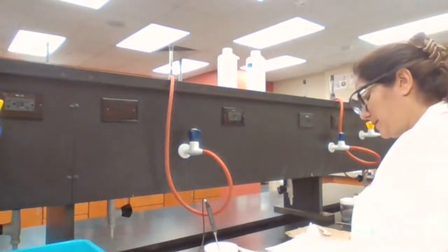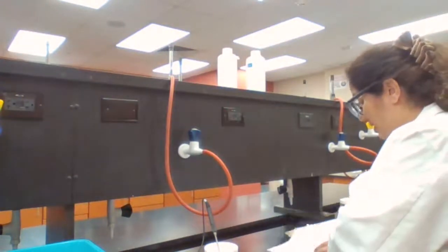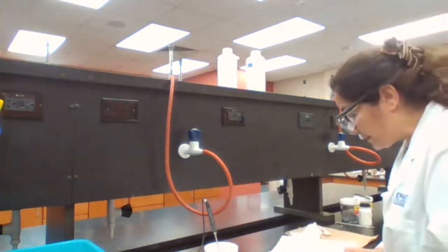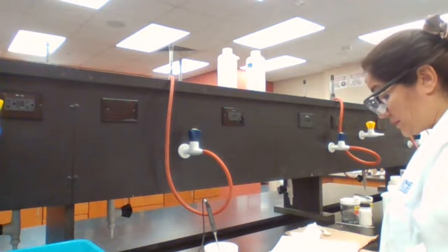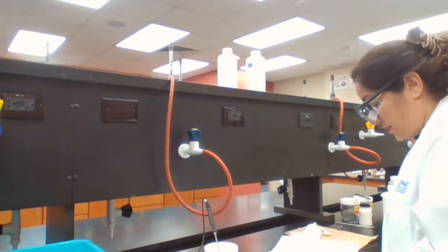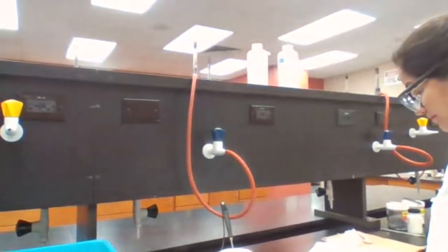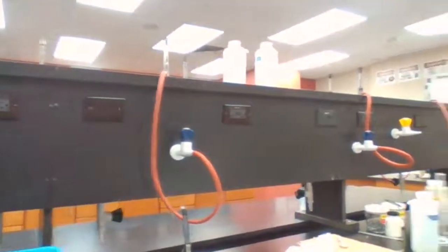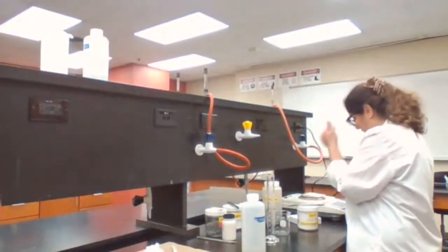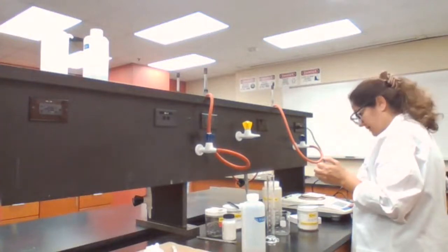While we are waiting, there's one thing I could do, because otherwise the calculation is not going to be accurate. So I'm going to get the 0.25 grams of magnesium. Okay, 0.25 grams of magnesium because I need it for later, for the second part of the experiment, just getting ready for it.